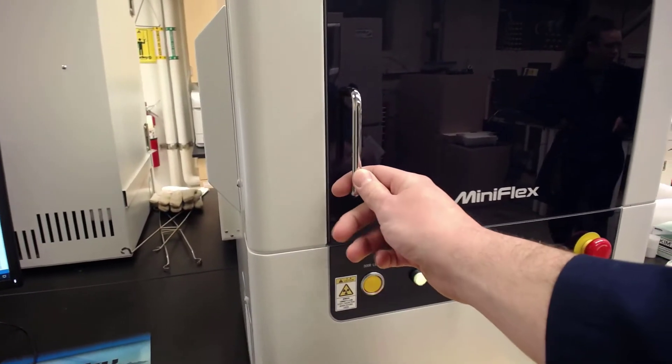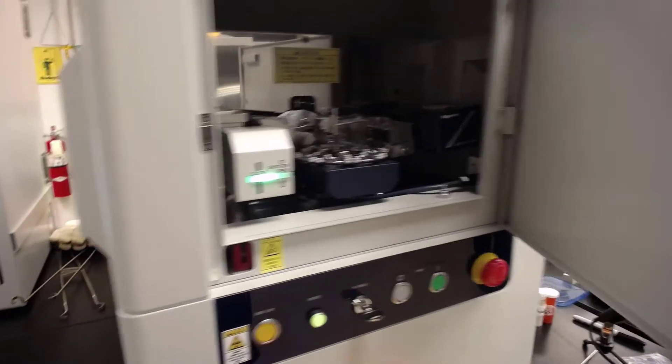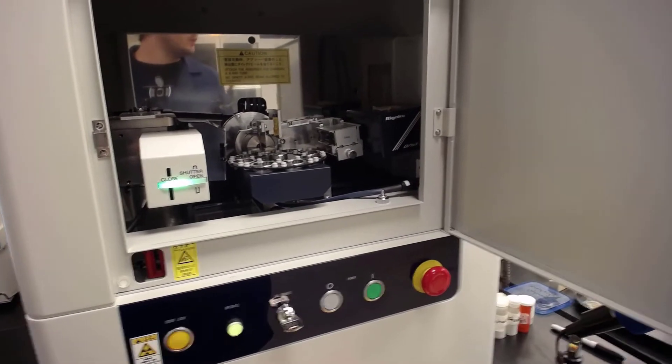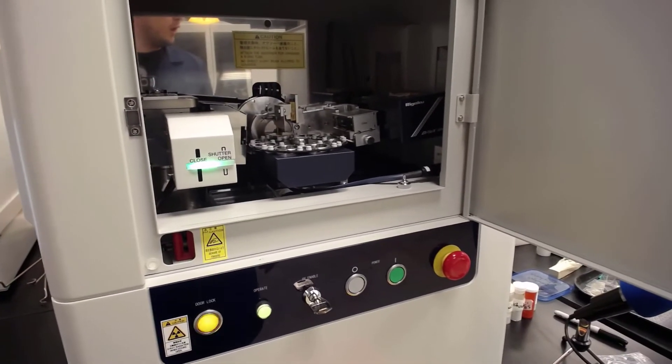If we open the door, we can look inside. The door is locked at all times and will beep whenever it is open. So unfortunately we cannot get rid of that.